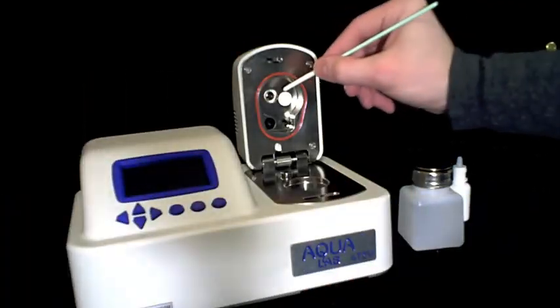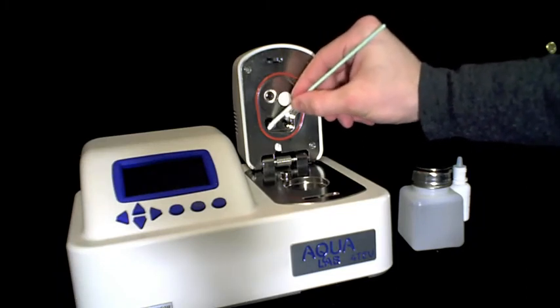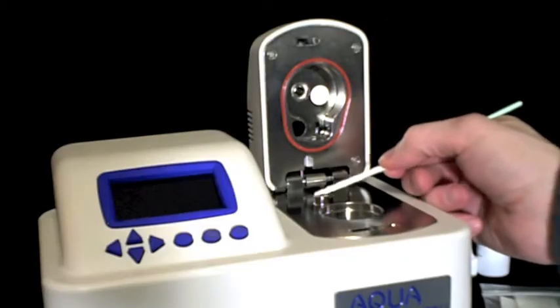As we did before, take a clean kimwipe, apply distilled water, and rinse the surfaces of the thermopile, the mirror, and then the optical sensor.